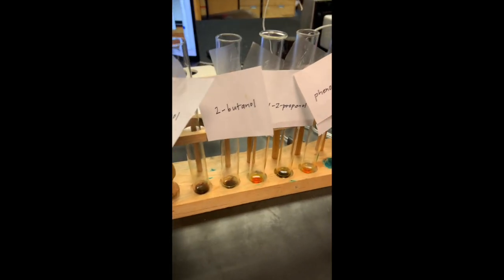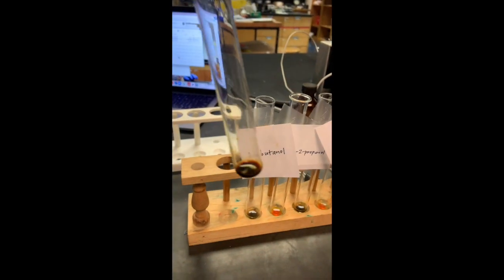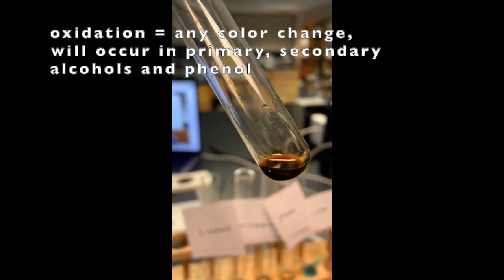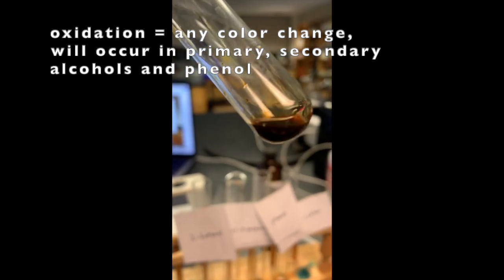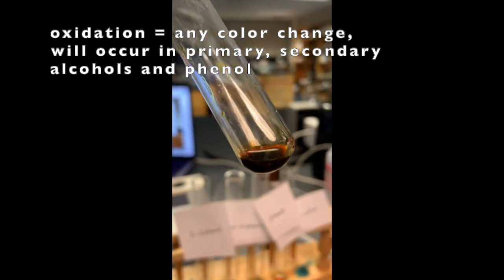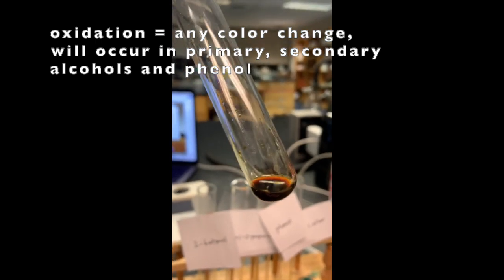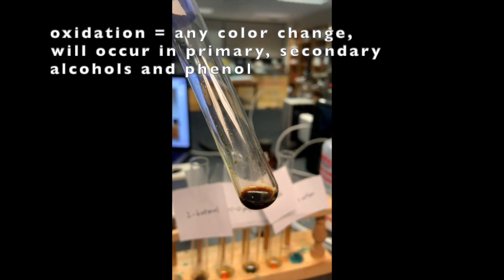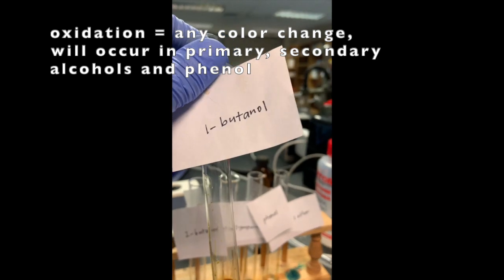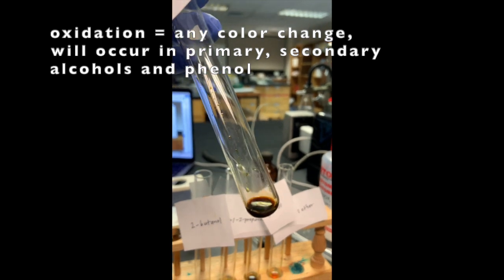Here we have our chromic acid test. We have our 1-butanol. I was hoping it would give me a bit of a green precipitate. If I look closely, I see a little bit of a green hue, but I'm wondering if I used too concentrated a sulfuric acid. But regardless of whether or not I see a green precipitate, I do see a reaction. So this alcohol, the 1-butanol, was oxidized because it didn't stay the orange color.